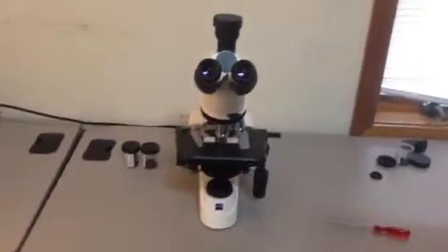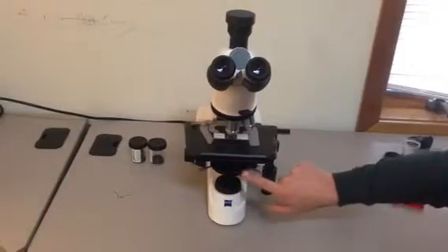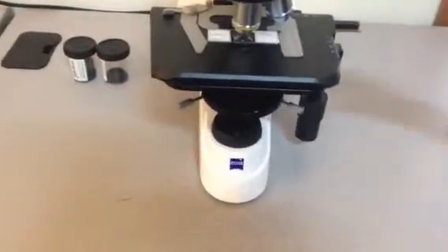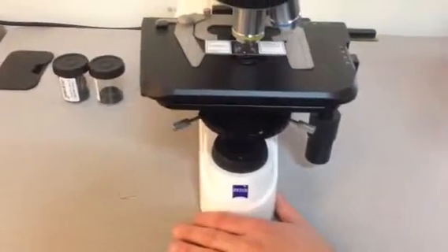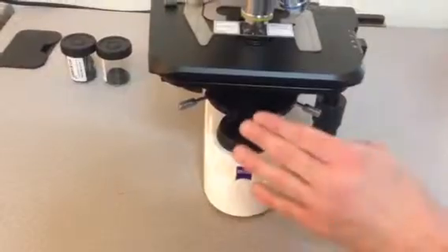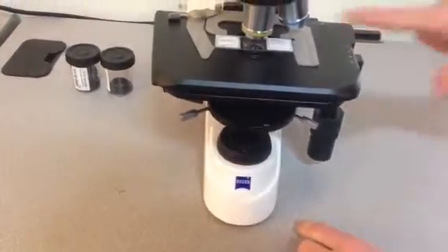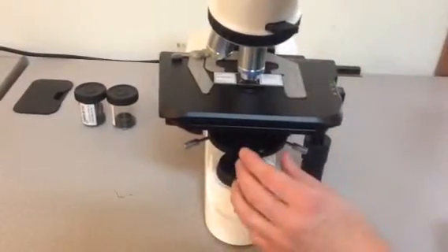The key thing to keep in mind for daily use is the condenser turret right here. You have five positions. BF is for brightfield — that's just traditional microscopy. When you're using phase contrast, which is the technique you'll use to contrast unstained specimens, you have three settings: phase one, phase two, and phase three. These correspond to the different objectives. When you're using 10x, you use phase one. When you're using 40x, you go to phase two.